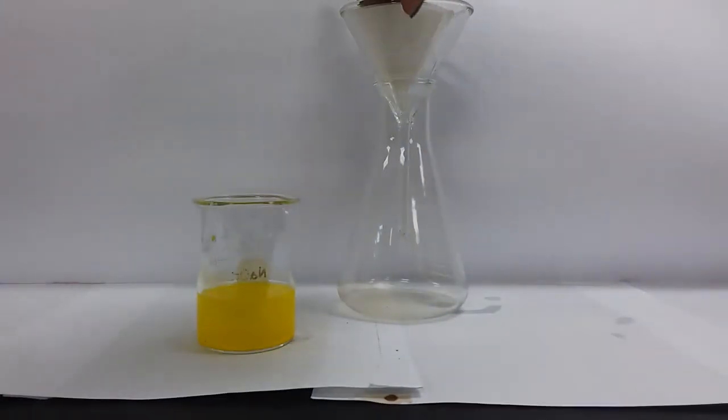Sometimes if our filter paper is not sticking, we will take some distilled water and just give it a quick spray, so that the filter paper would stick. In this case, my filter funnel is a bit damp, so that I don't have to do that. The filter funnel is sticking on its own.